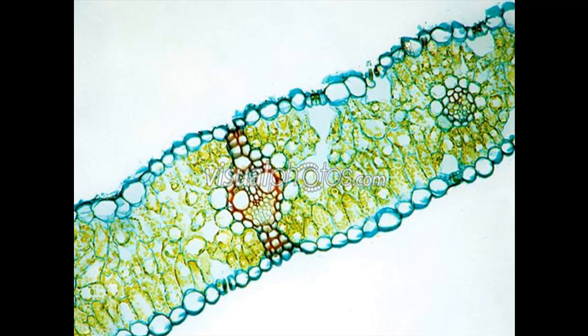And we can see clearly the xylem and the phloem, so xylem here, phloem here, and the bundle sheath around the outside, and possibly a little bit of collenchyma, maybe parenchyma, but probably collenchyma at the top and the bottom. It looks like they're quite similar to the bundle sheath cells. Again, if you're not 100% sure, stick with the ones that you can definitely label.